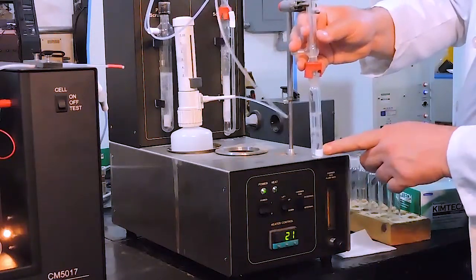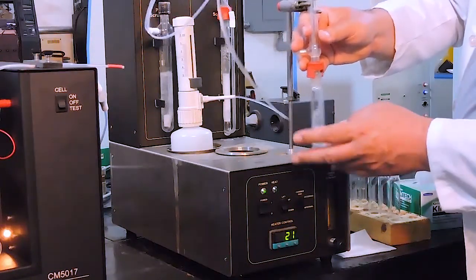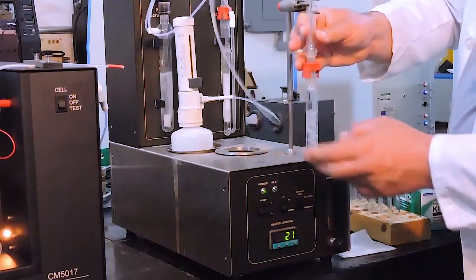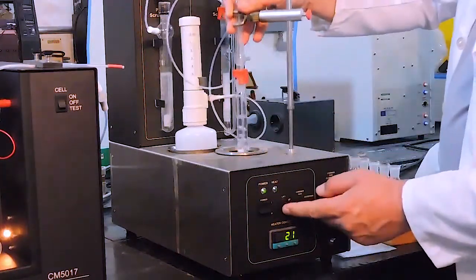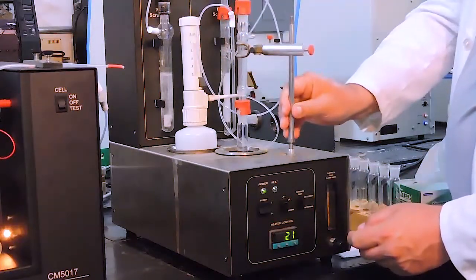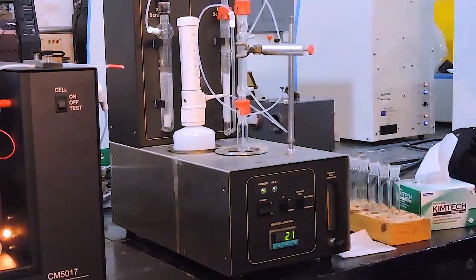If you notice that there's a bubble in the Teflon cup, tap the flask gently before placing it in the heating block. The system will measure until it reaches % difference criteria, and then it will stop. At that point, you can press Lift, then change the sample flasks and put another sample in.